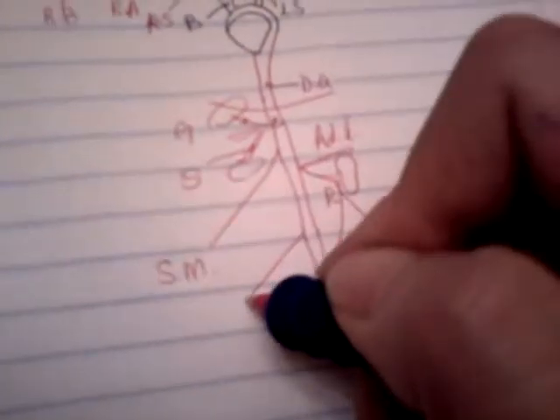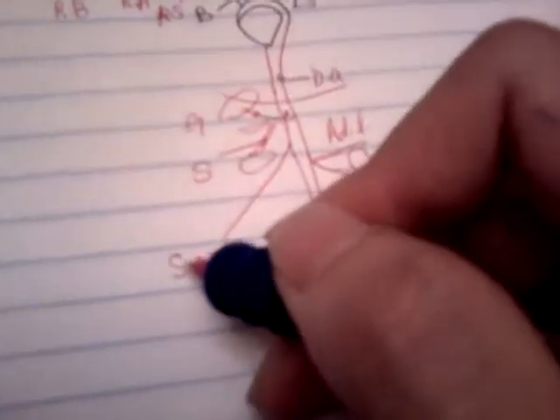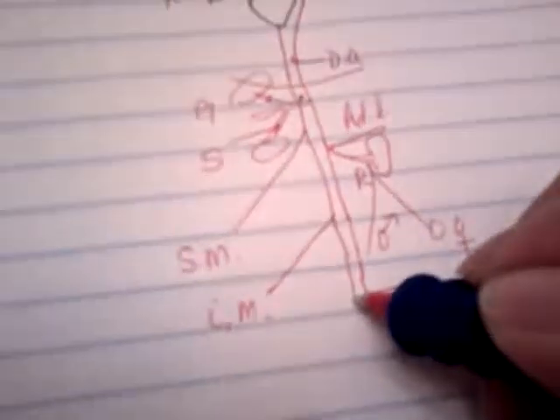As it travels a little bit farther, there's another branch about this far down from the superior mesenteric, which is the inferior mesenteric, which makes sense. It's inferior to the superior. And down here, there are two arteries that branch out perpendicular to the descending aorta, and these two are called the iliolumbar arteries. And they're very skinny. And just below that, it branches out like this. Well, not this big, it's smaller in diameter.